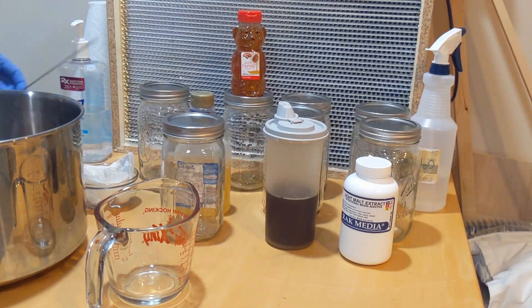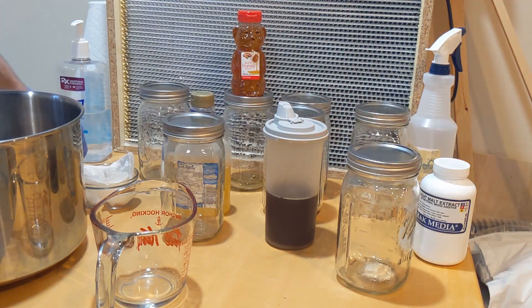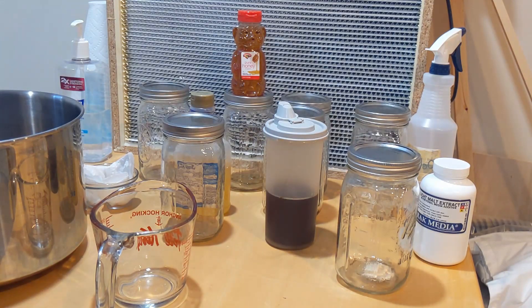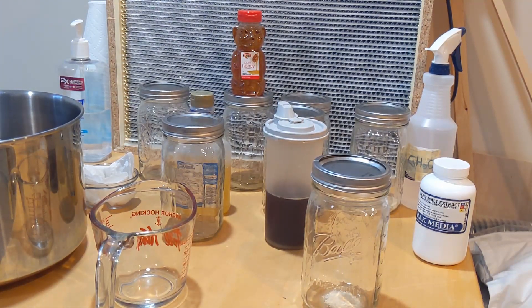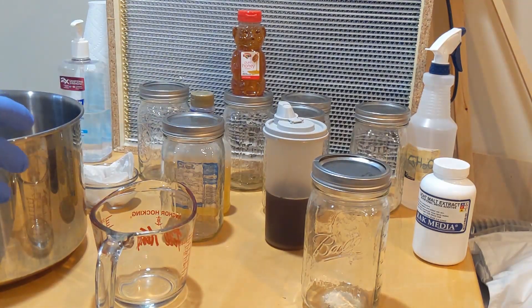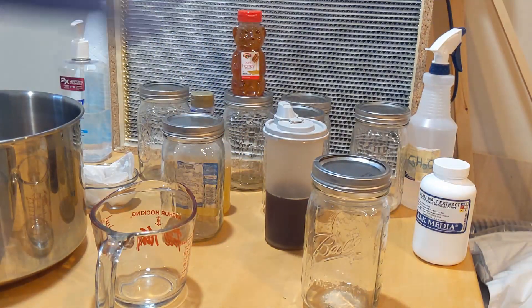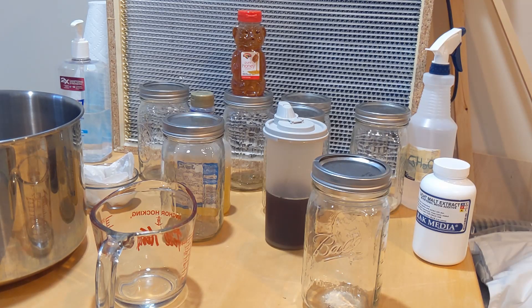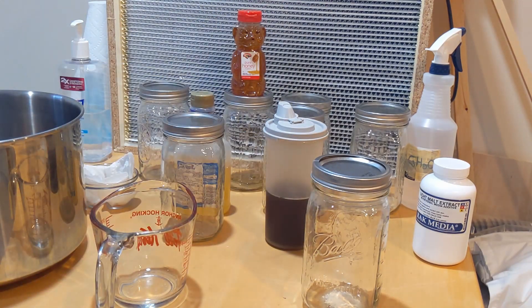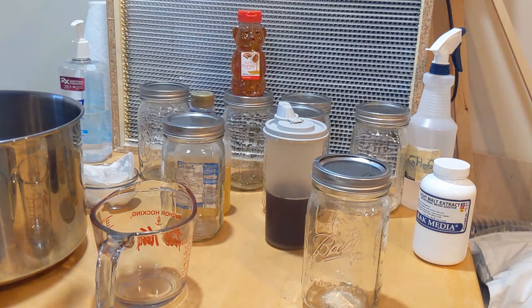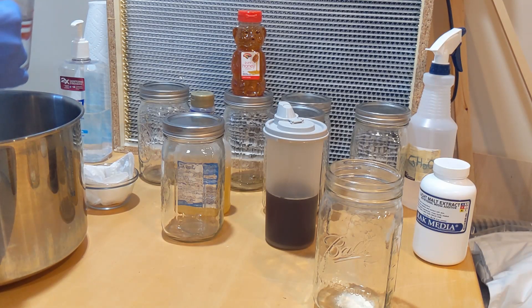Okay, we are back. So we're just going to fill this up with 600 mils of water. And I've got just a little tool just to pop it out. Probably not the best. Like, if you would want to do this using one method, what I would recommend is actually heating up your water and then making your stock batch in your pot or something. And then fill up all your jars to 600 mil and put that in pressure cooker. Just because I'm doing like three different or four different variations today, I'm just going to do one jar by one jar. But obviously, if you're making like six or seven, it's all the same in uniform. Mix everything in your water and then fill up your jars.